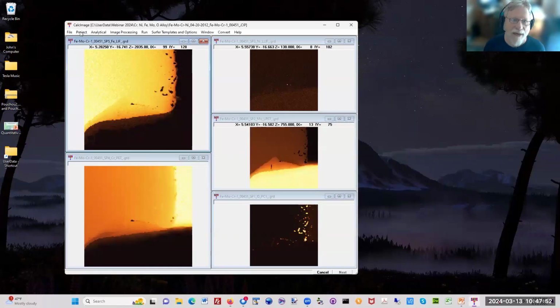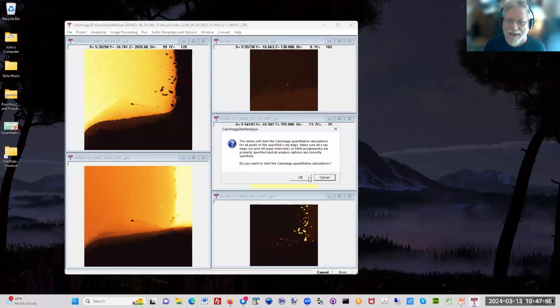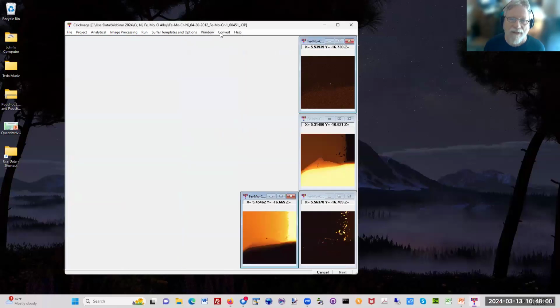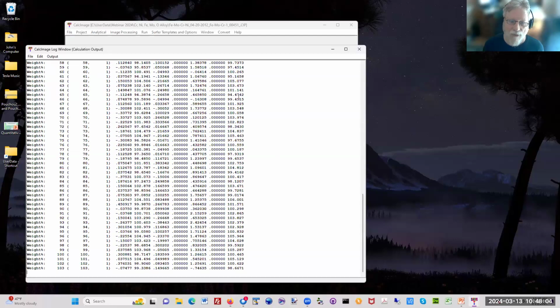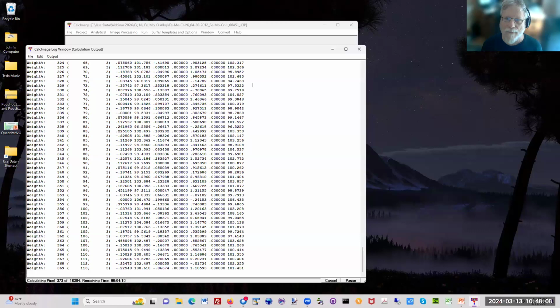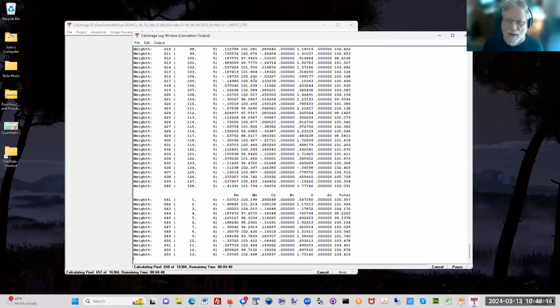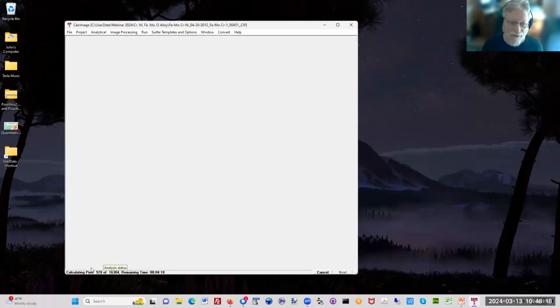And then I can quantify the map. I just click here, calculate quantitative images, and I'm going to say okay. And this will take a few minutes. I'm going to open up a little log window, and you'll be able to see the actual quantification occurring right here. And there's the total column here on the right. But if you notice, it's a little slow because it's updating this log window. If I close this log window, you'll see it run a lot faster down here.